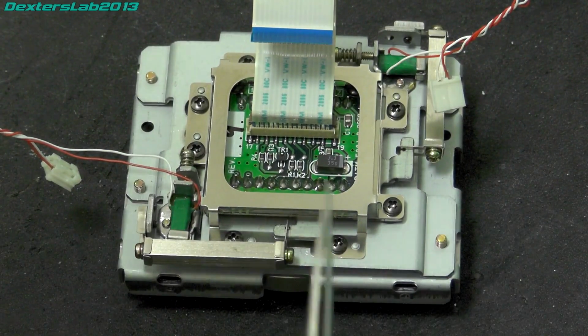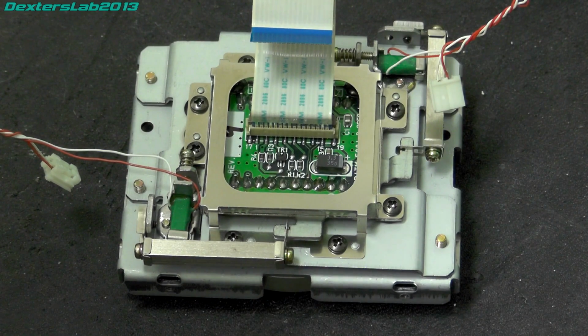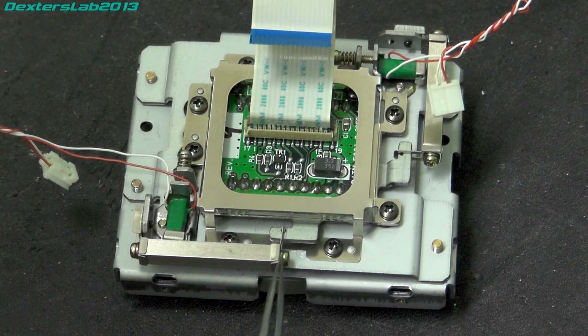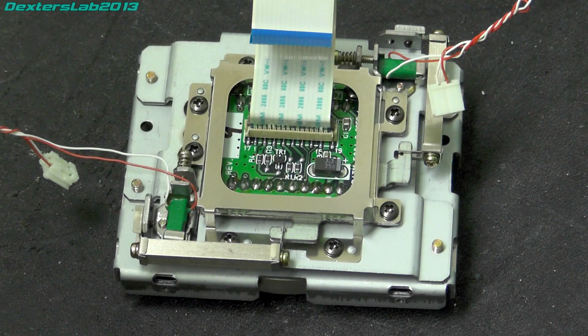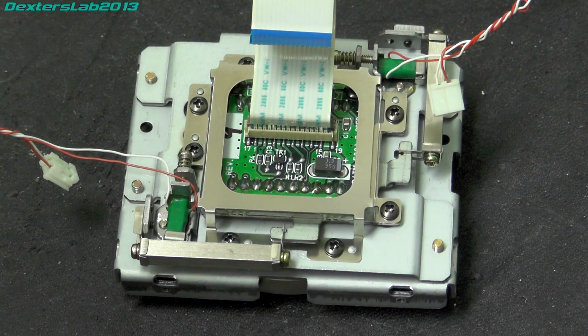Now, one interesting thing I've noticed is this bar here is quite loose. I expected this to be under some kind of tension, but it's not. It's pretty loose, so any movement I would have thought would have been negated by the slack that's in that. But it's possible that when this actually starts up and it's under software control, it might actually preload these to a sort of preset value, so it takes out all of the slack in the system. So unless I had a working setup, I wouldn't really be able to see that.